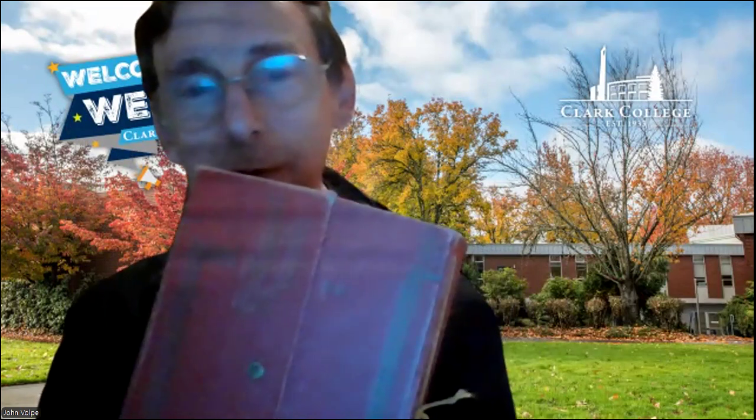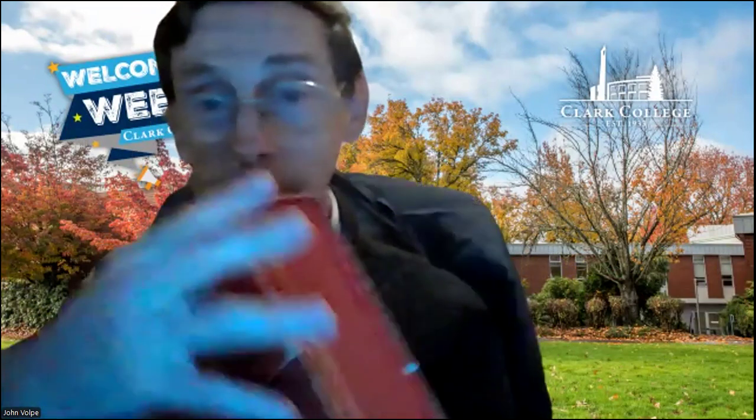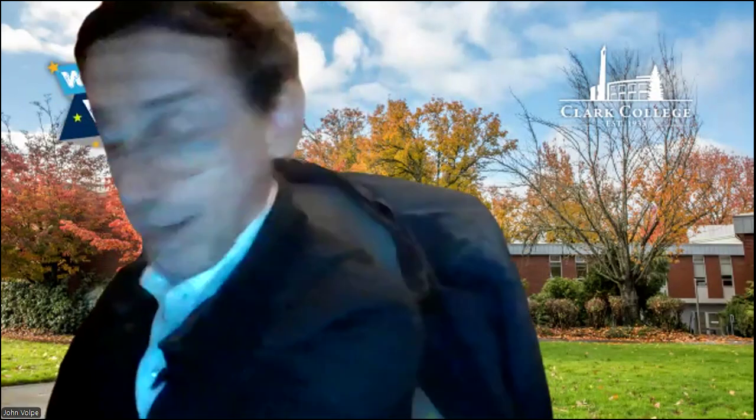The book is about this big. Each page of this book has a culture medium, and that tells you how many different culture media we have in microbiology — it's over 300 pages, and each page discusses one media. So in microbiology, we have a very large number of media that you can grow the bacteria in. Obviously in the lab we don't have that many for you to use, but that's how many it's possible to use.